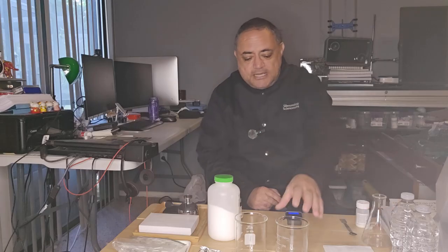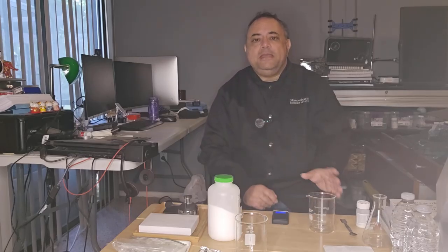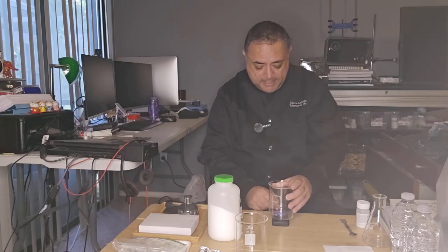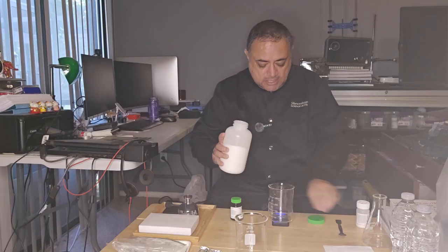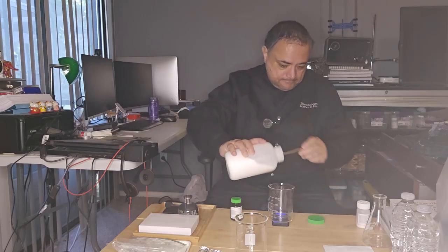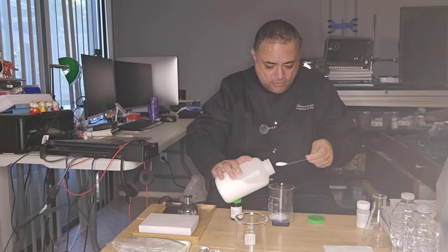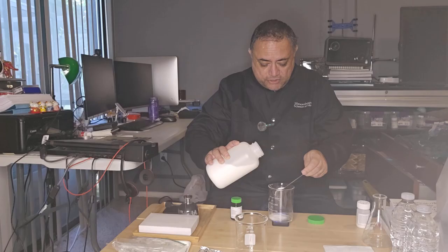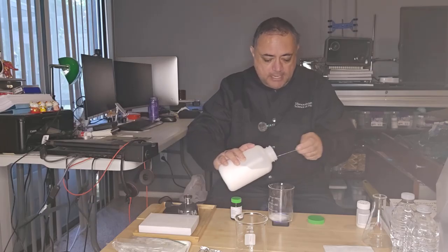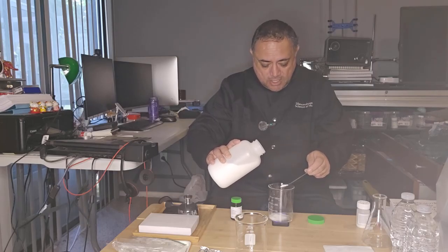So before we actually do the experiment itself, let's make up the solutions that we need. Okay, we need to make a glucose solution. So I've got my beaker here and a balance. I need to weigh about 6 grams of glucose, and then I'm going to dissolve that in the water. It doesn't have to be accurate. This experiment works at different concentrations, different strengths of solutions, and the ingredients really don't have to be exact. The reaction will still occur.